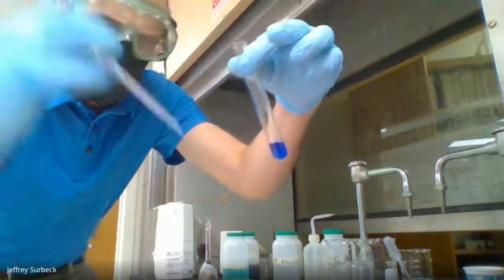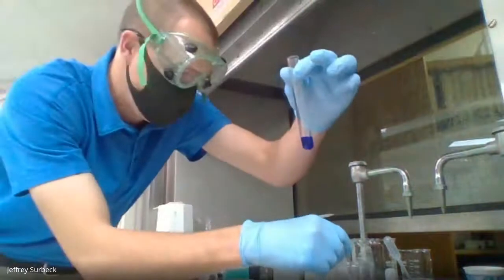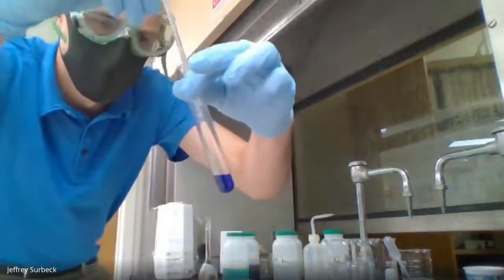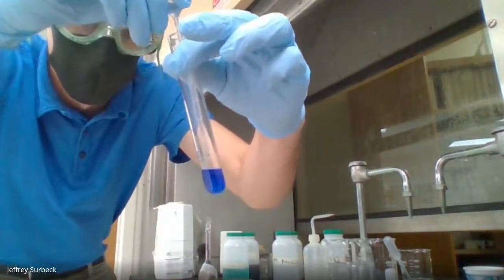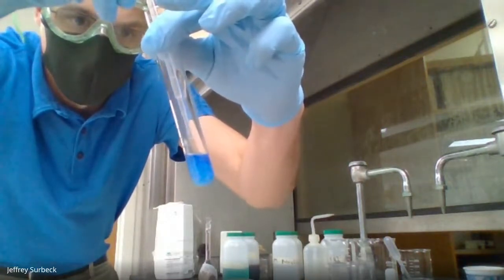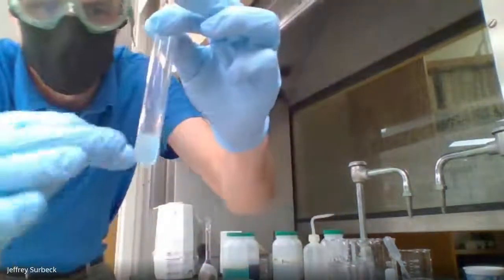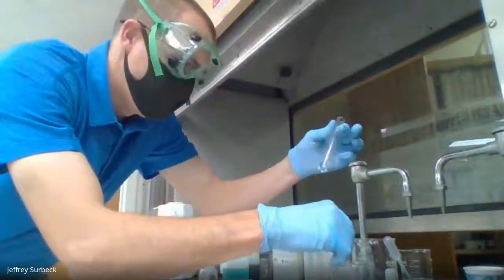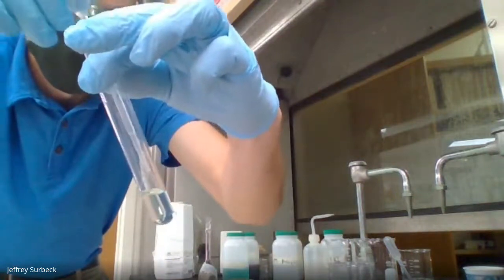Okay, so you might not be able to see it on the video, but I am starting to see some change, but not significant enough to what I'd like to have. So I'm going to keep adding drop by drop. All right, check that out. I'm going to mix this up real quick and check that out. All right, now I'm going to add just a few more drops of HCl.